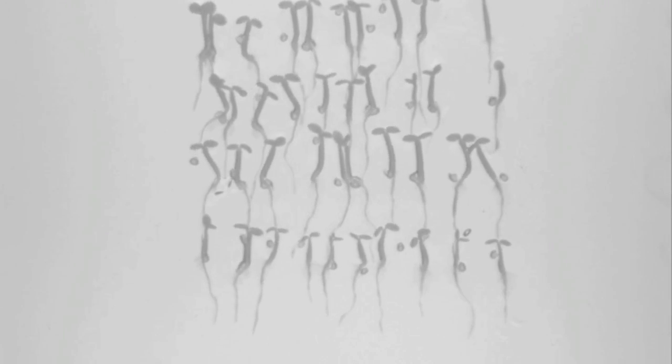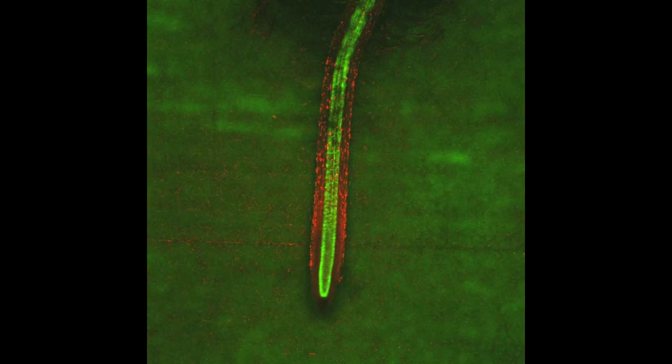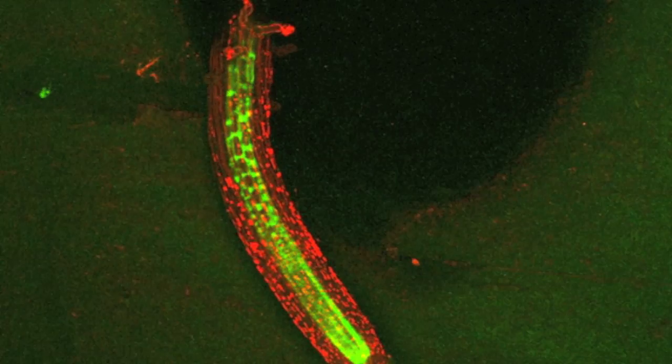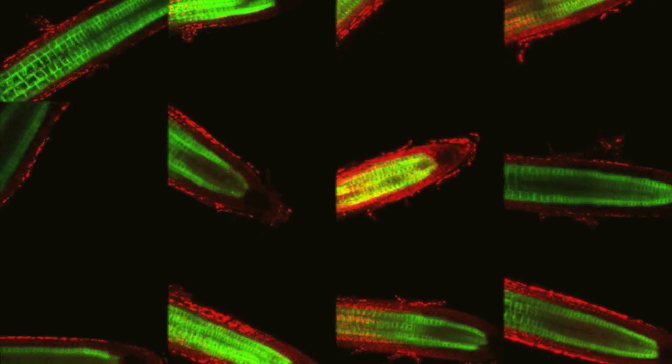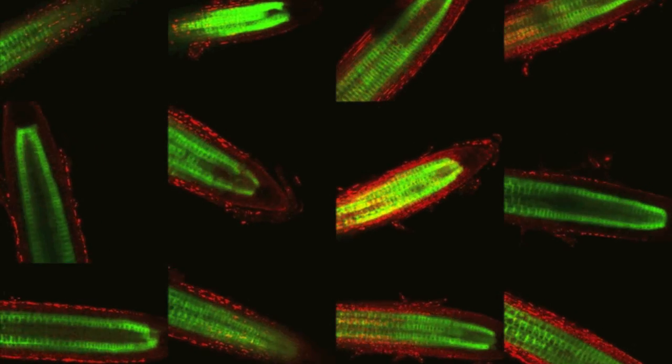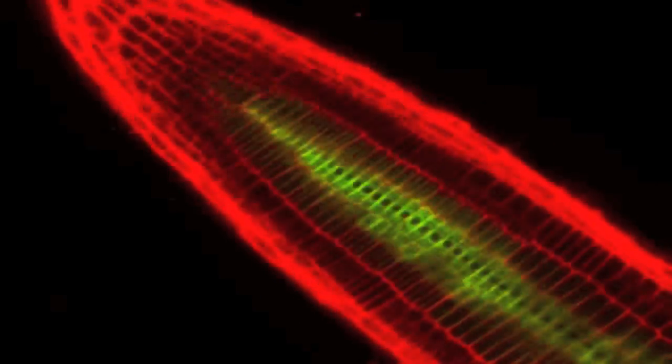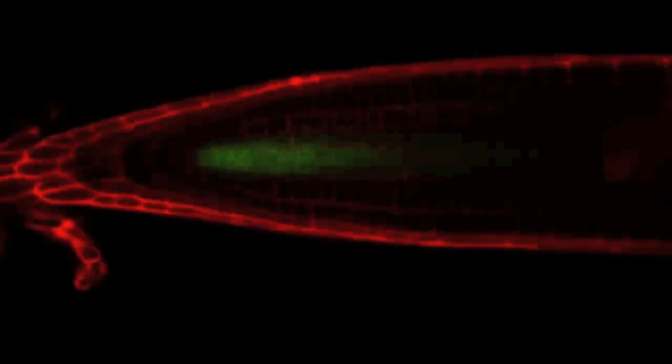be monitored. The growing root of Arabidopsis is particularly well suited for real-time imaging and analysis of gene expression in both time and space, but the challenge lies in conducting live microscopy on a large number of specimens grown under controlled conditions. Our goal was to obtain time series recordings of gene expression at tissue-specific resolution in a large number of plants with minimal human intervention.